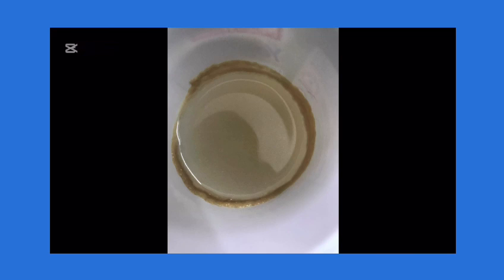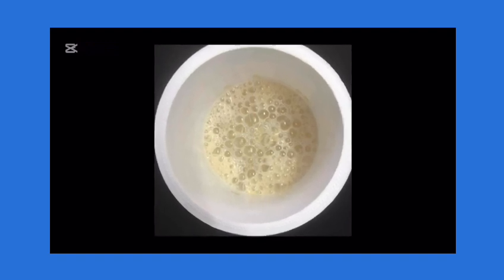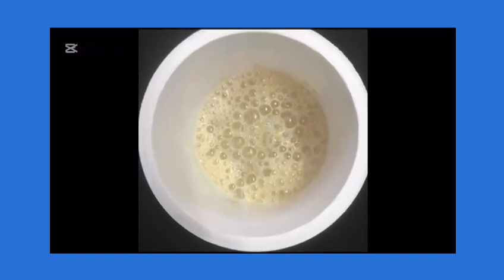After 10 minutes in container A that has cold water, the yeast did not really react with the water or even produce any effervescence. So comparing with container B that has warm water, the yeast is activated much faster, produced effervescence or bubbles also faster, and as well as the smell that was more strong in this container than container A. There was more smell, and you could also hear some sounds or effervescence of the yeast reacting and forming carbon dioxide.